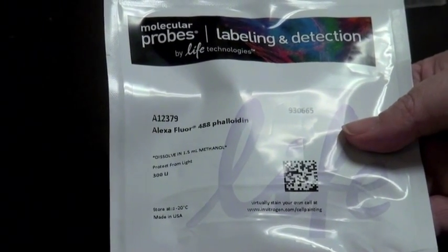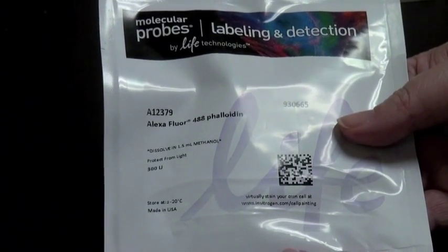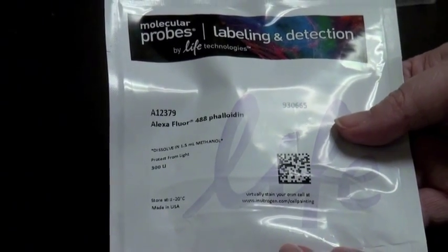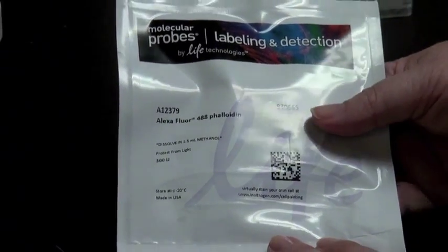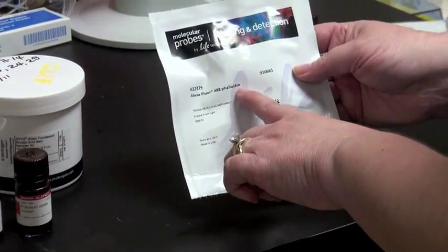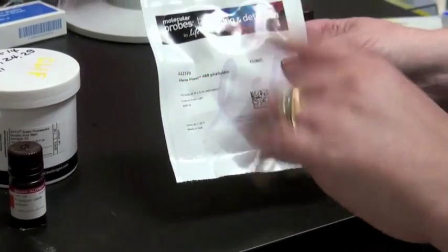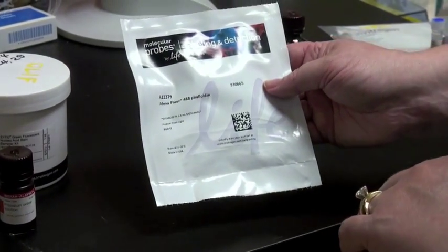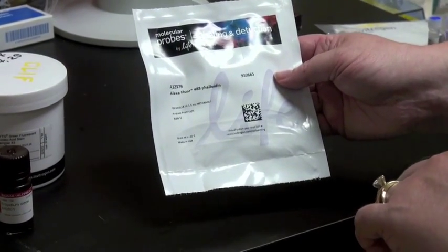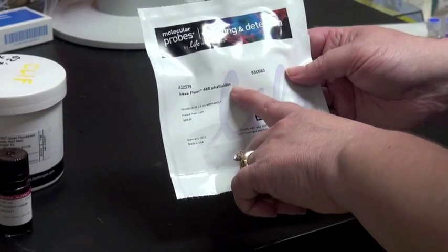Phalloidin comes in almost any color that you could think of. So if you have specific secondary antibodies to proteins that you're interested in, you can pick another color phalloidin so that you can have the actin cytoskeleton stained as well.